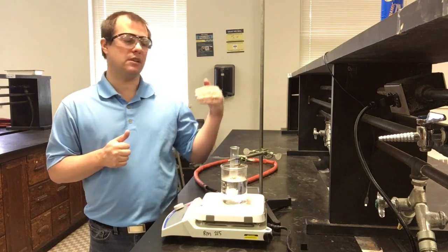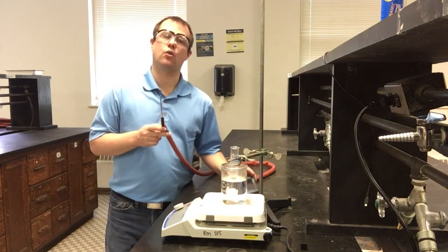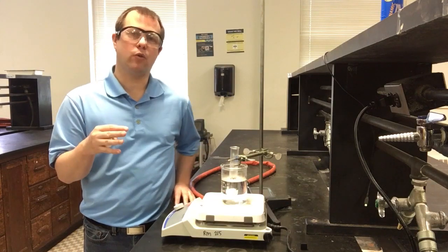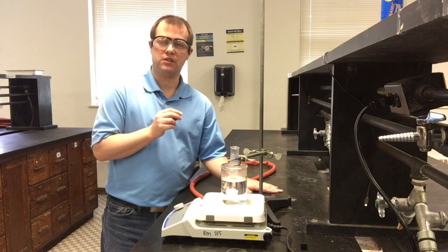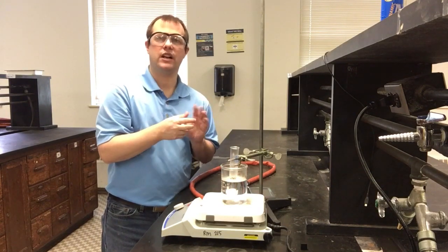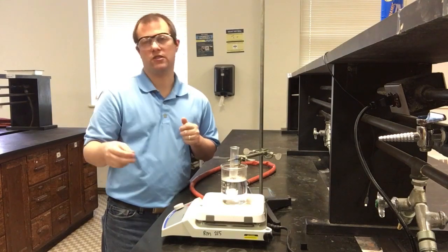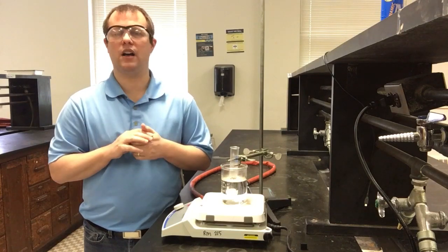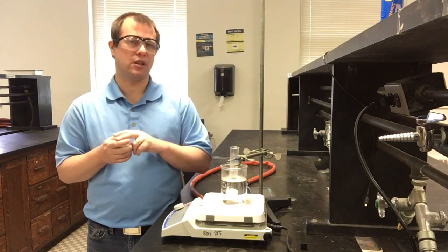Then I'm going to pull it out of the hot water bath, and I have a thermocouple here that will be recording measurements of the temperature change over time. On this LabQuest that I'm going to use to make these measurements, we should see a decrease in temperature, but then eventually we're going to hit a point where the temperature either levels out or plateaus, or maybe even spikes back up a little bit before it starts to decrease again. That little plateau, and hopefully if we're lucky a little spike as well, is what correlates to our freezing point. So we're going to have two temperatures that we'll really keep an eye out for.